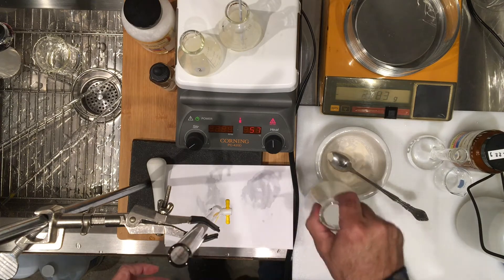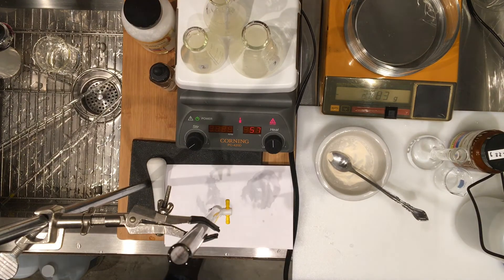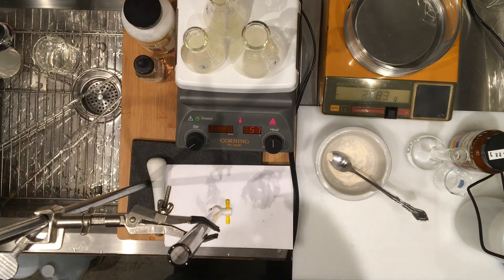Now this one has to get dissolved too. We have our three flasks on the hot plate because vitamin C is water soluble, but being ascorbic acid it does need heat to dissolve — that's why we're putting them on the hot plate. After roughly 20 more minutes when they get hot, I'll remove them, add some water, and do the titration. I'll show you the titration for these three flasks once we give it enough time for the solid to dissolve.